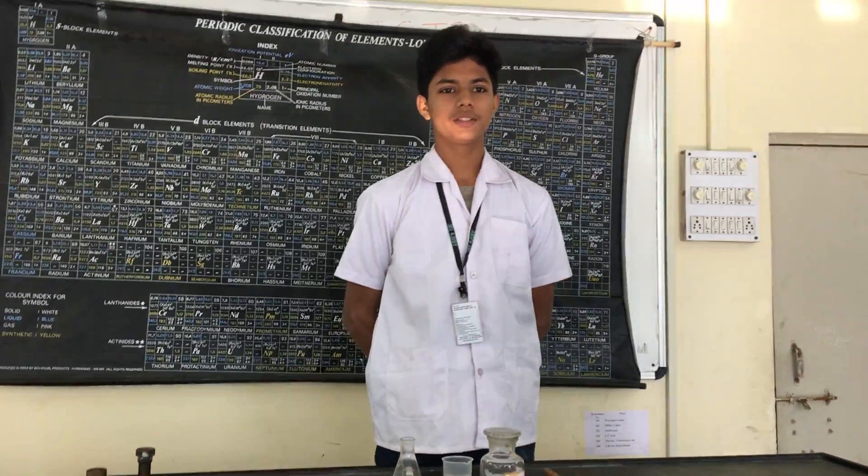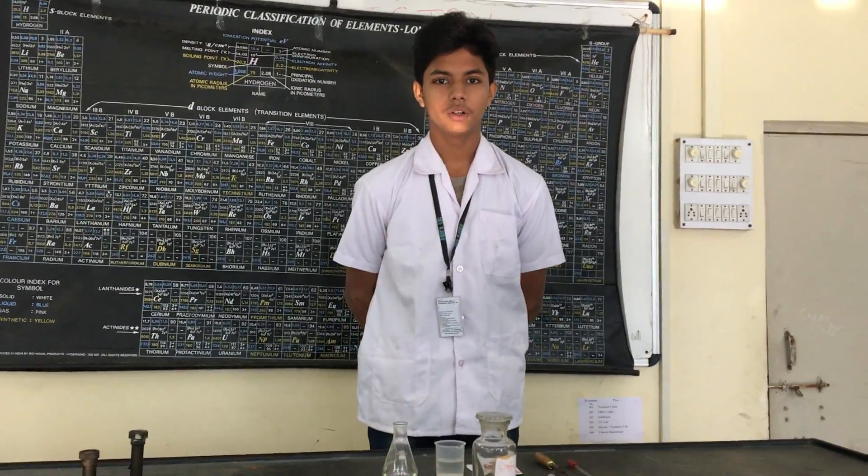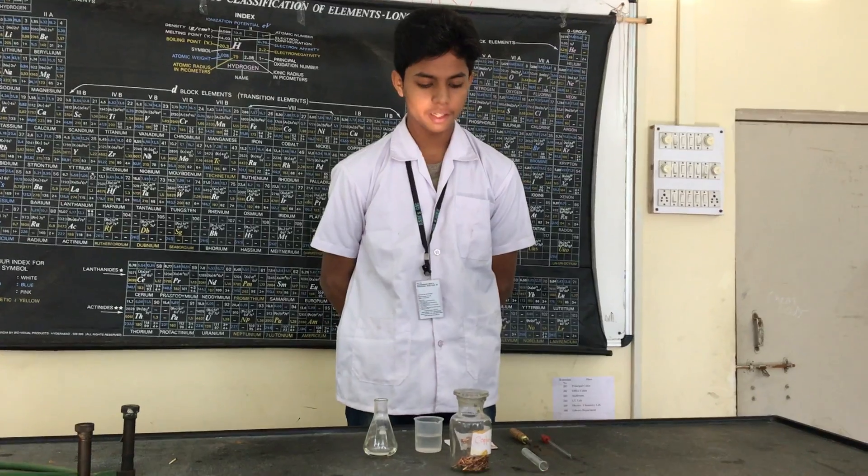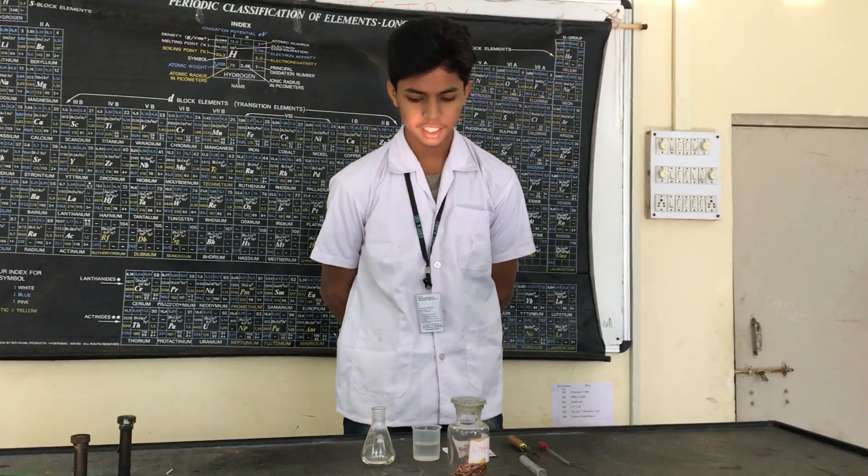Good morning everyone, my name is Timish Zagi. Today I am going to start an experiment on a displacement reaction.